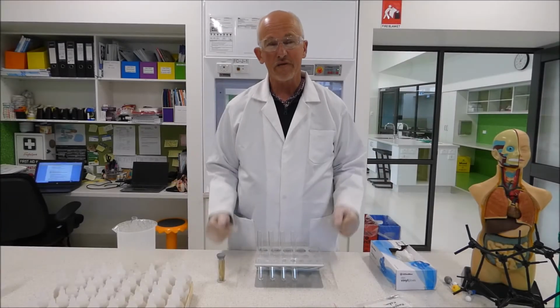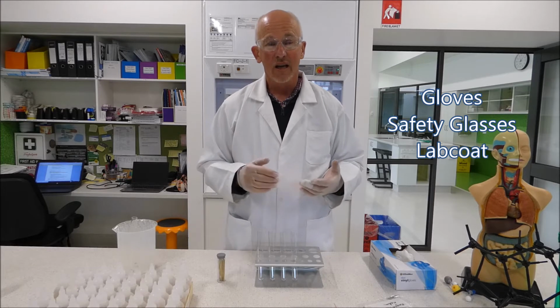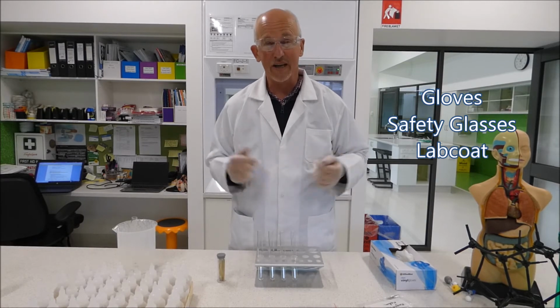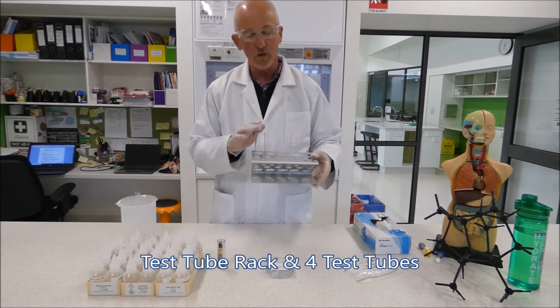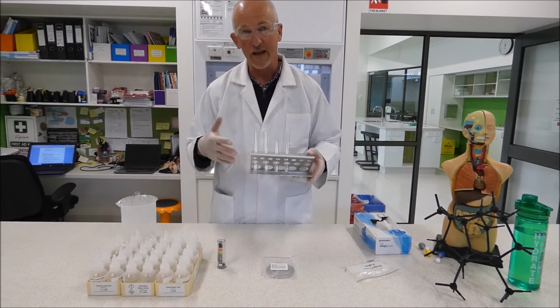What materials do we need for our experiment today? Well, firstly, of course, safety equipment as always: gloves, because we're going to be handling acids, safety glasses, because we don't want to get acids into our eyes, which are obviously quite bad for our eyes, and a lab coat to protect our clothing. So the equipment we need for today is going to be a test tube rack. We're going to need 4 test tubes to actually do our chemical reactions in so you can observe the chemical reactions and how they look.